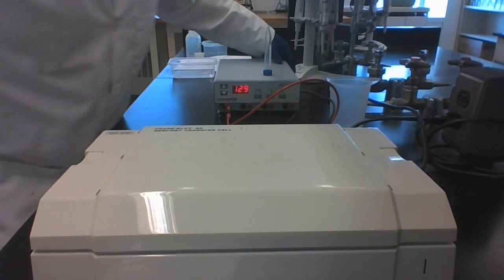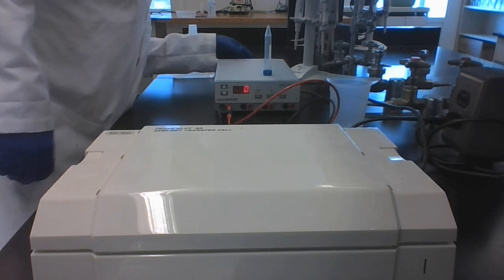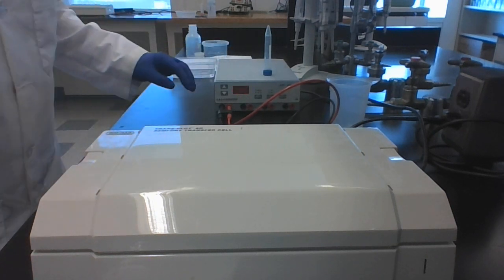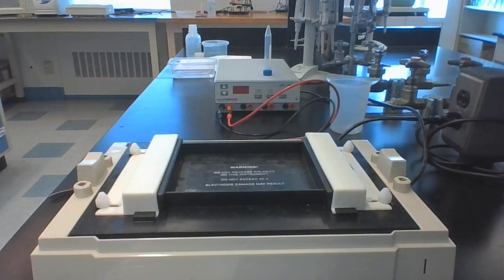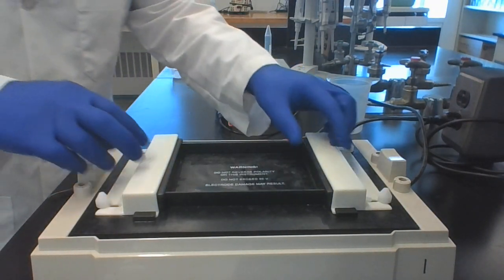Okay, so we're now done. Turn off our power supply. And now we just take this apart. Take out the first lid. Now we take off our negative electrode.